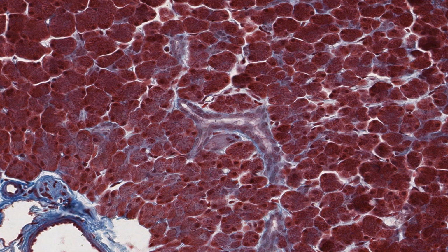The relationship of the various ducts to the lobular structure of the pancreas is a little different to those of the main salivary glands, those that deliver their secretory products via ducts into the oral cavity. The intralobular ducts are of the intercalated variety.